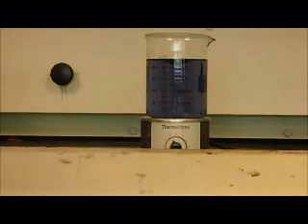And so now we're going to violet, and this is when the Ce3 plus is reducing the blue Fe or iron 3 plus, and it's going to become the red Fe2 plus. But the stage between the blue and the red colors creates the violet that you saw. Yes, and it will get to a better red than this. It's a little slow at times. This whole, oh, there we go. Now, and see, it went through the blue transition stage, which now was back at green.